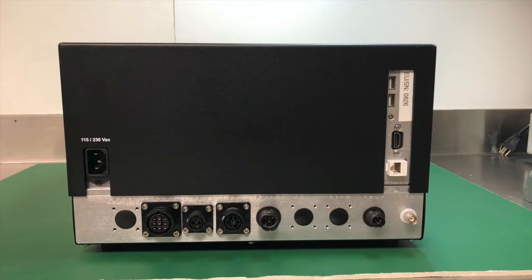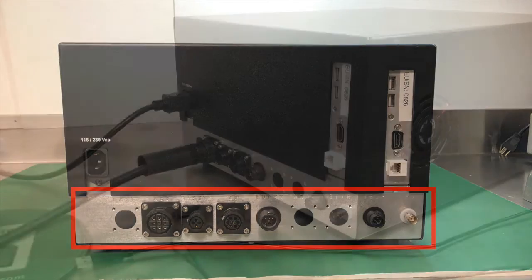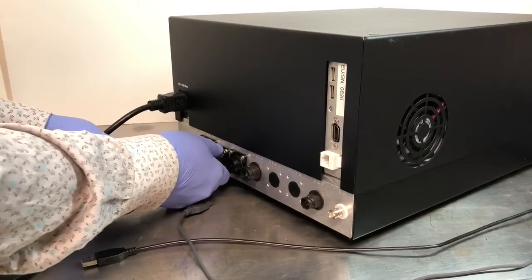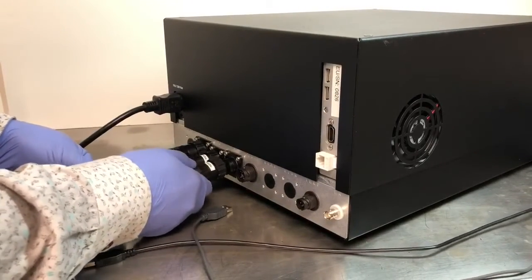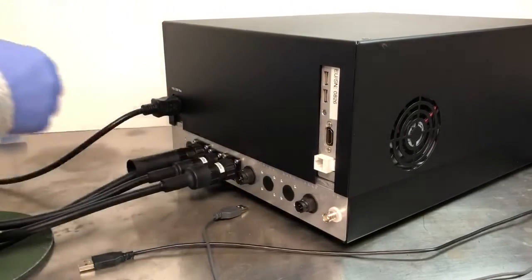At the bottom of the rear of the electronics box are a series of ports for the sensors of the DT1202. The amount of ports here varies depending on the options purchased with the instrument. All sensors can be plugged in by hand, requiring no additional tools. Be sure, when plugging in the sensor cables, to properly align the plug with the port in order to avoid cross-threading. The ring on the plug is turned clockwise until it locks into position. You should feel it click into place when the plug is fully connected.